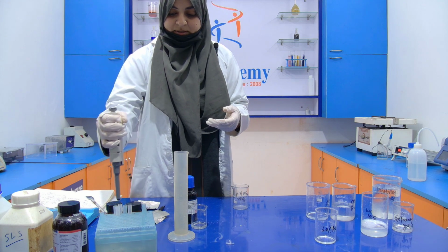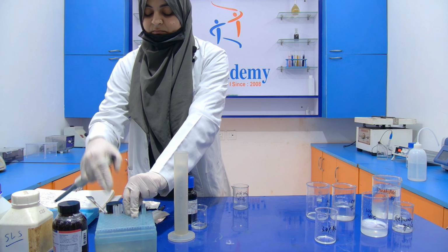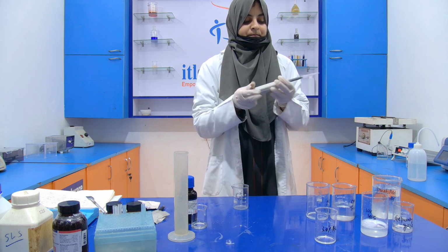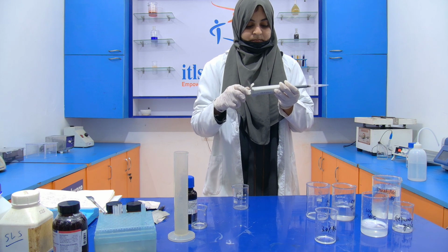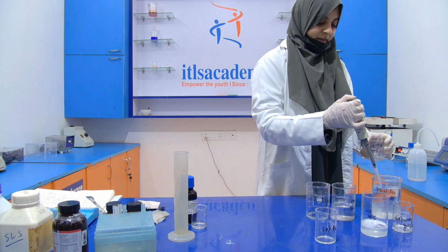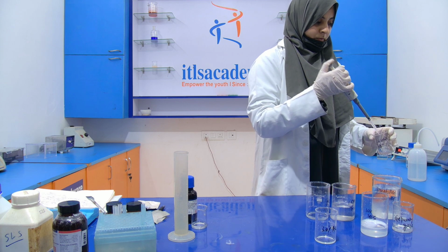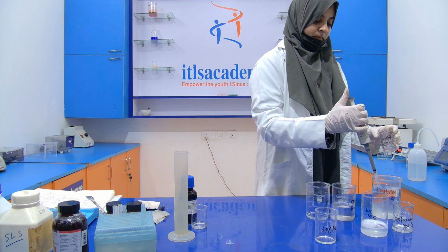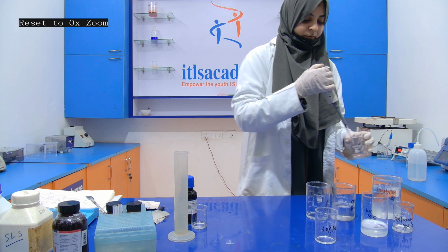So first of all, you have to measure 1, 2, 3, 4, 5.